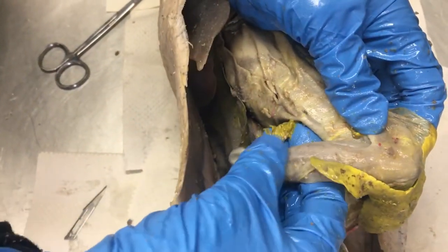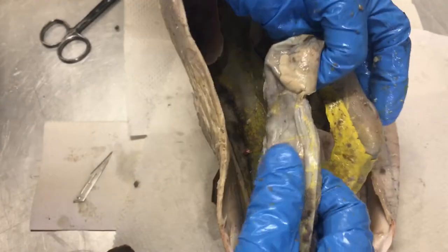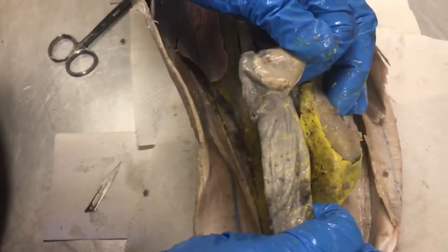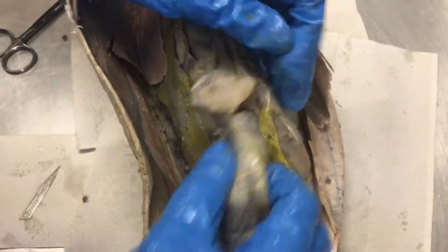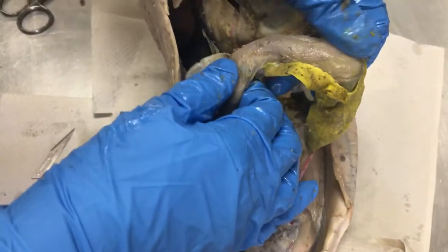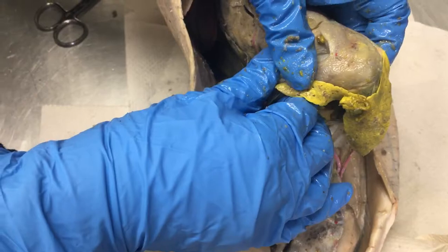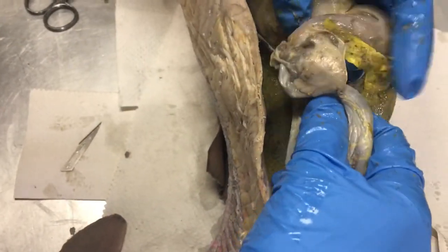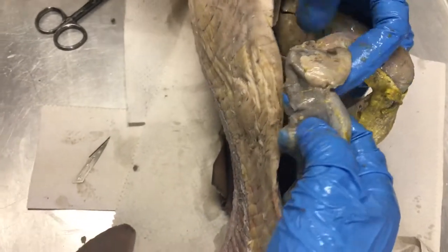This last region of the stomach leads into the small intestine area — there's the duodenum and then the ileum, which has a spiral valve. The duodenum is connected to the pyloric section and is right in here, underneath the pancreas, which is right here.